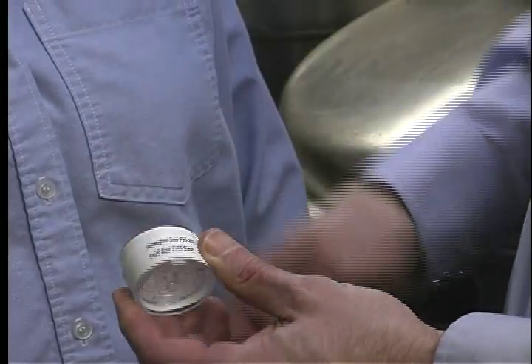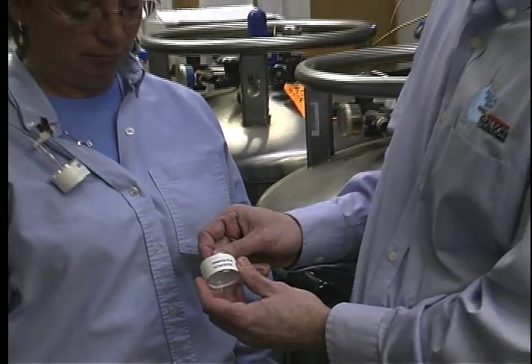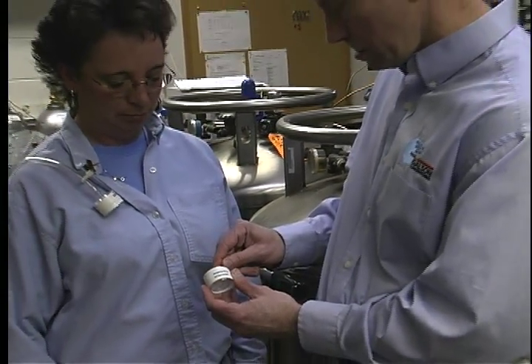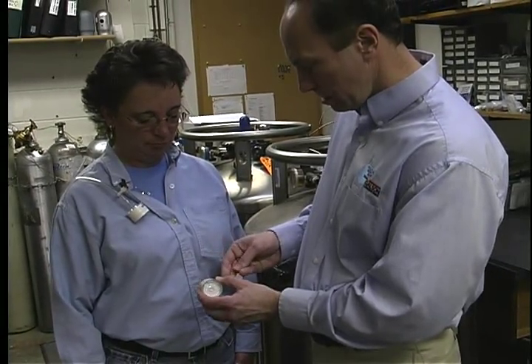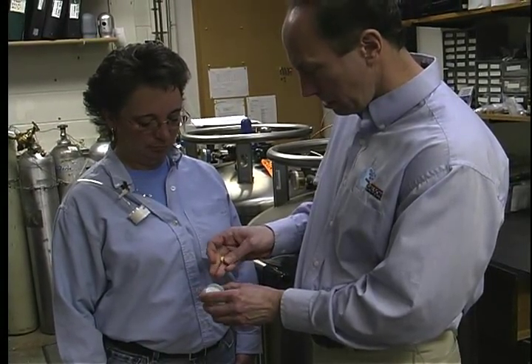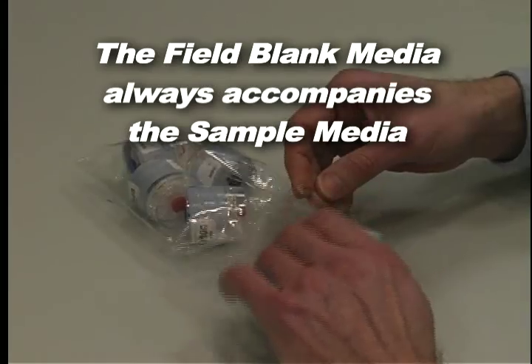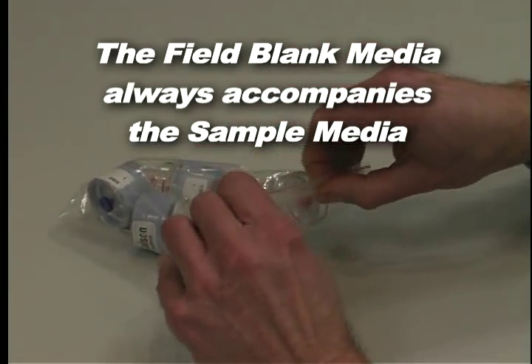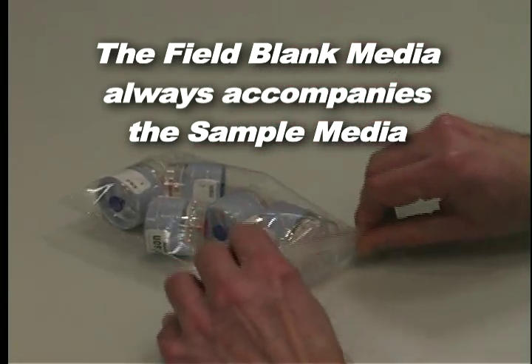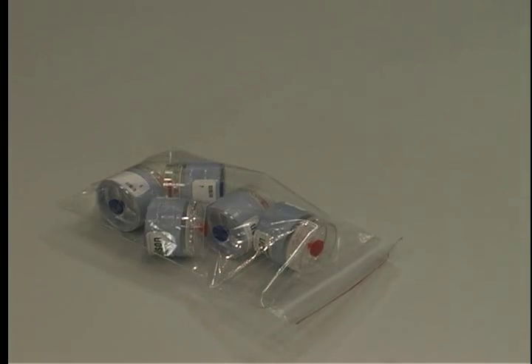If you knew contamination was present, you would eliminate it. The field blank is to identify inadvertent contamination during handling, storage, and transport. So, it is important that the field blank media always accompanies the sample media except for during actual sampling.